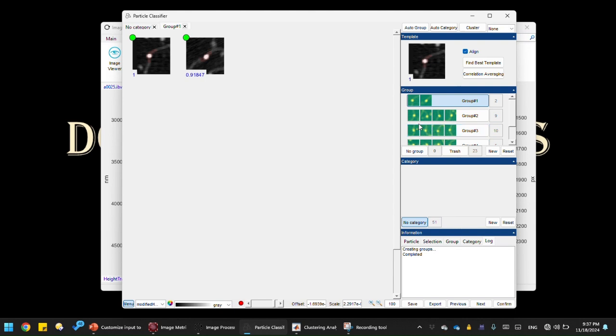In our example, we are interested in the conformation of the protein DNA complex, mainly in how much the protein bends the DNA. So we are interested in the bending conformations, and that's what we traditionally analyze. Of course, we would probably also be interested in how the protein sits on the surface, whether it sits tall, like in this case, or whether it lays flat on the surface. Right now, as you can see, in the first group we have these two complexes, but the DNA bend angles are not the same. This is a bent state, and this is an unbent state. So while the proteins look similar, the DNA conformation is not the same.